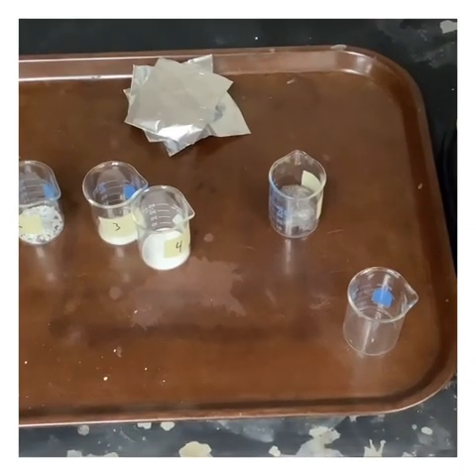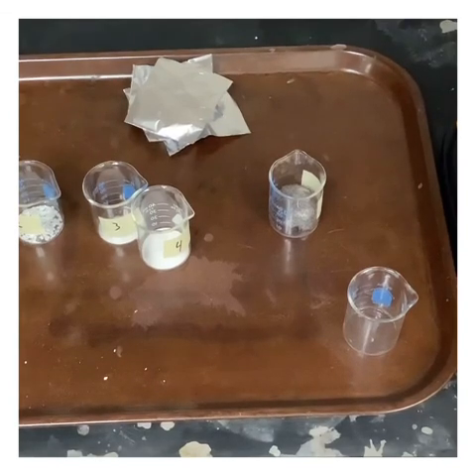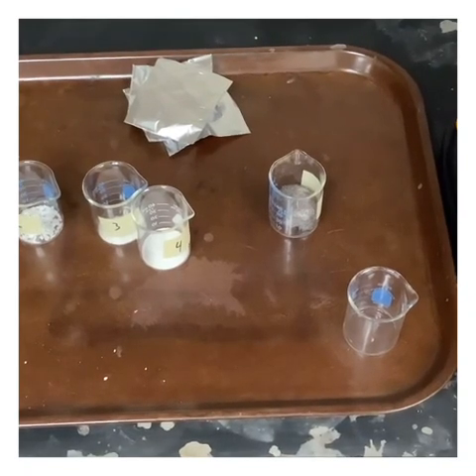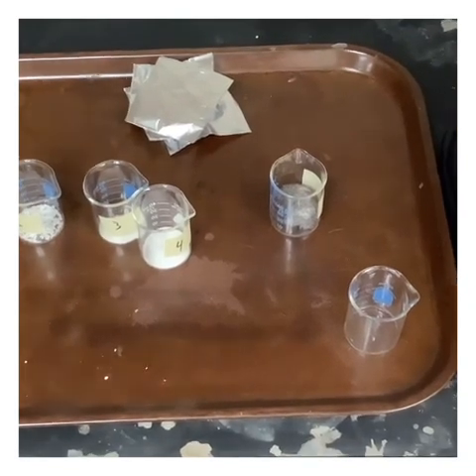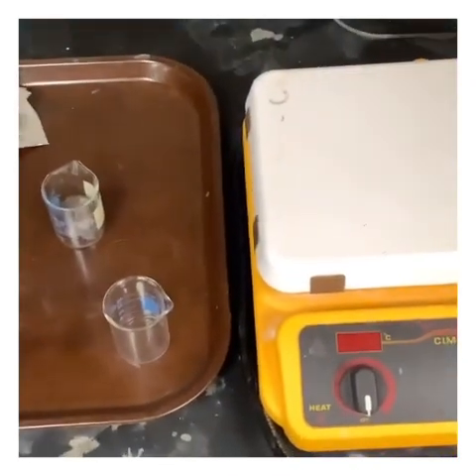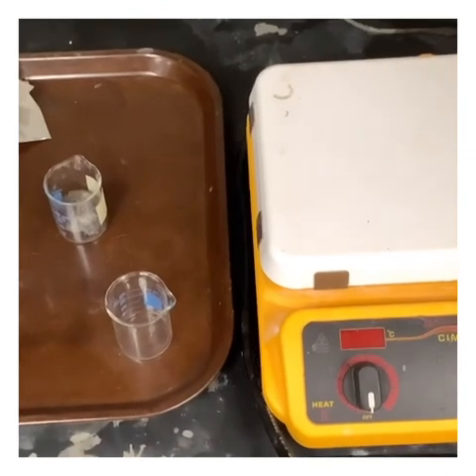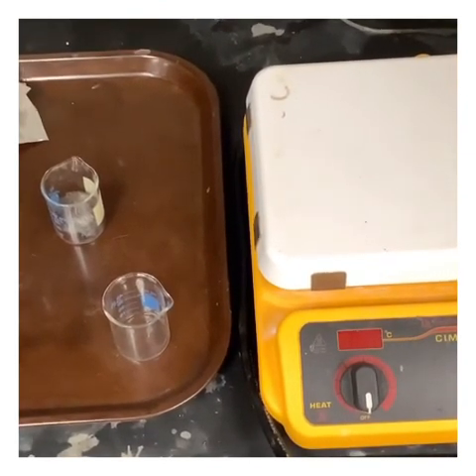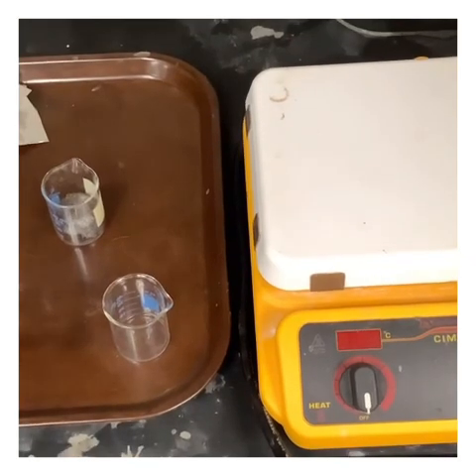For the next part, we're going to go ahead and test the melting points for each one of these. When we're doing the melting points, we're just basically going to rate them as having either a high melting point or a low melting point. High melting points are usually things that are in the thousands of degrees, right? You're approaching 1,000 degrees or something like that.